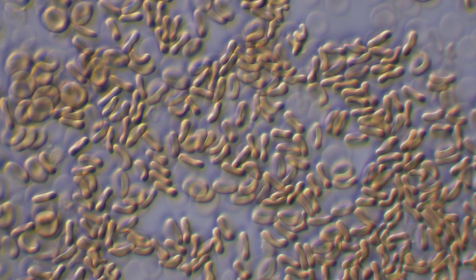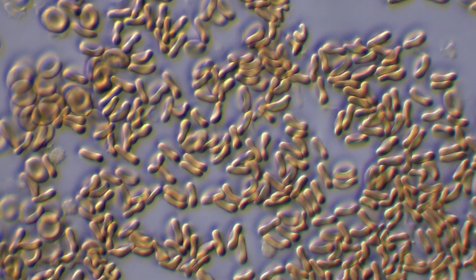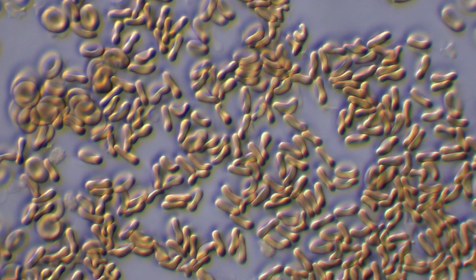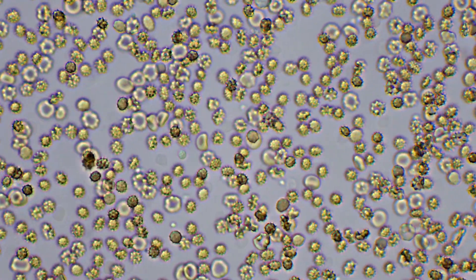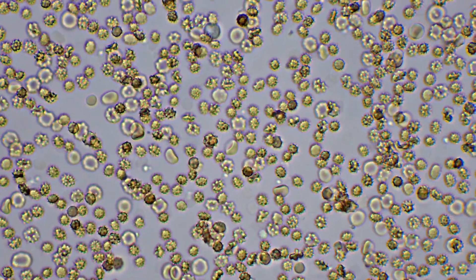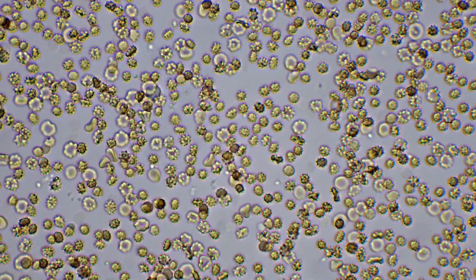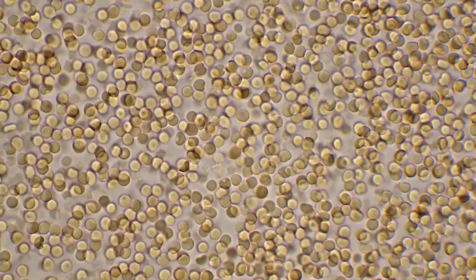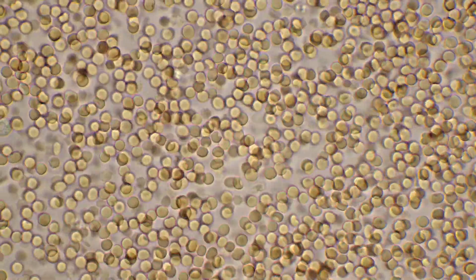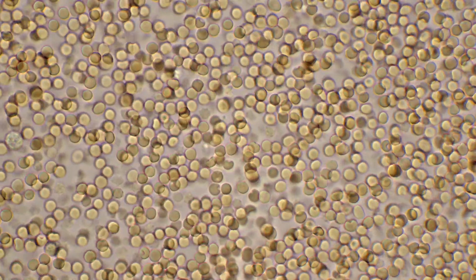Over its lifespan of around 120 days, a red blood cell will circulate the body more than 200,000 times before it gets retired by the spleen. These cells are usually shaped a bit like a donut, but here I have increased the salt concentration, which pulls water out of the cells and makes them shrivel up to a star shape. If we decrease the salt concentration, water rushes into the cells, which expand like a balloon until they burst.